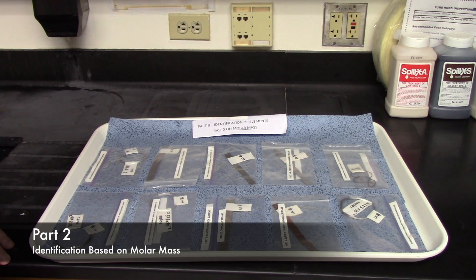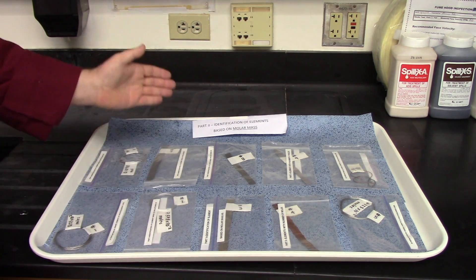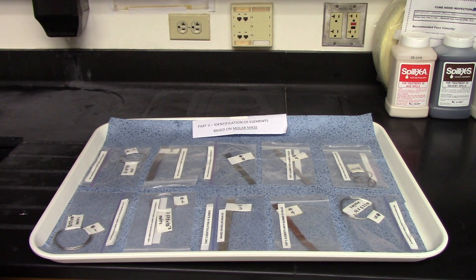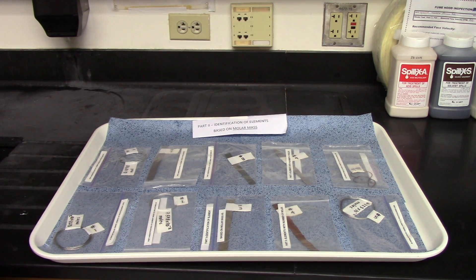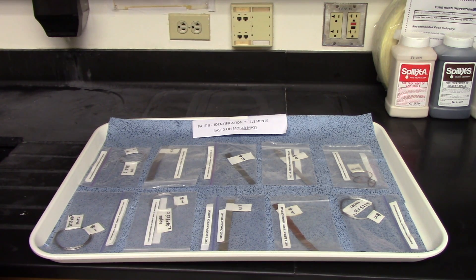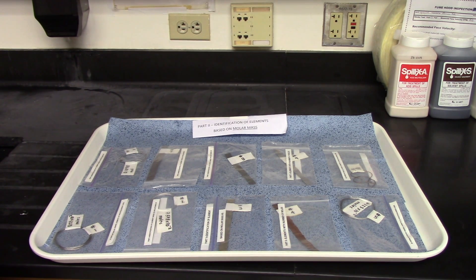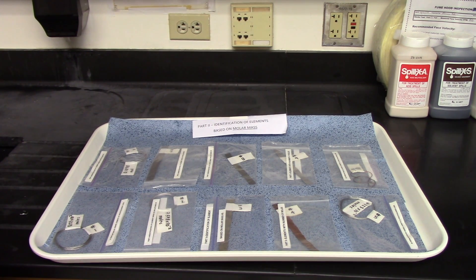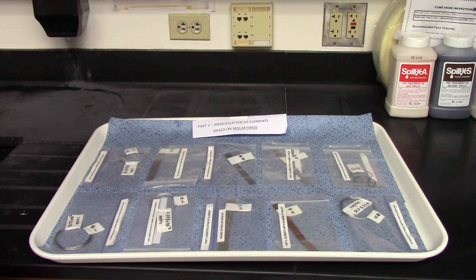Part two of today's experiment requires us to determine the molar mass of some unknown metals. Here we have an assortment of metals — please pick two of them, write down the unknown number and the number of moles contained in the sample. The number of moles is written clearly on the bag or on the piece of metal. Remove the metal from the bag, place it on the scale to get the number of grams, then simply divide the number of grams by the number of moles and you have molar mass.